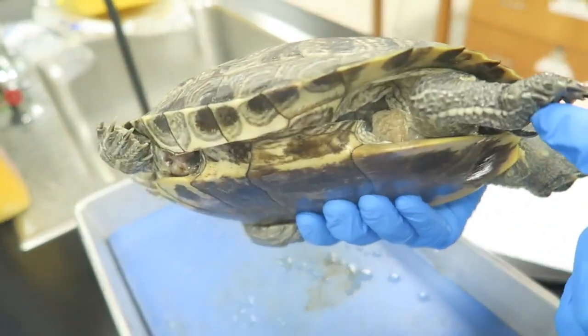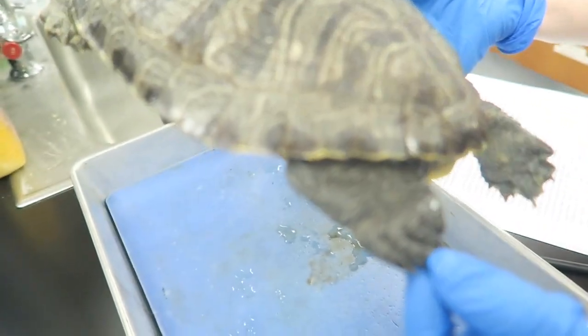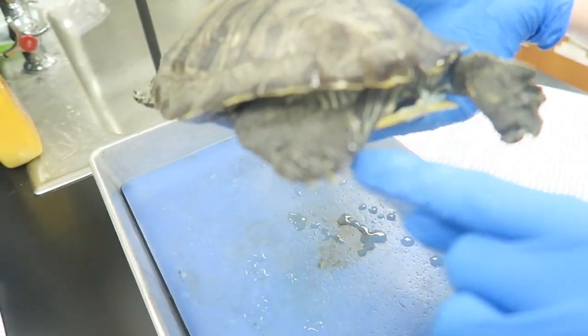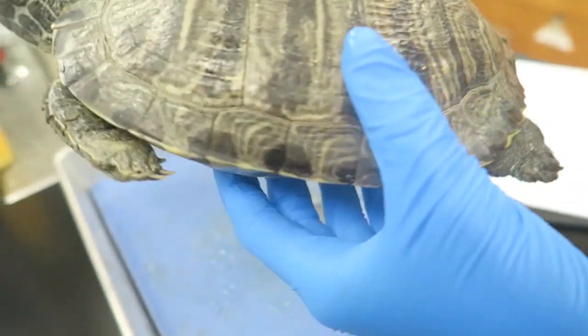This is actually an adaptation of animals that live in both terrestrial and aquatic environments. Towards the posterior end you can see the muscular post-anal tail, which helps the turtle change directions while swimming.